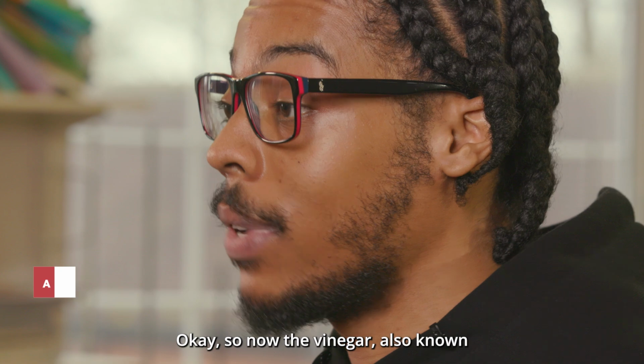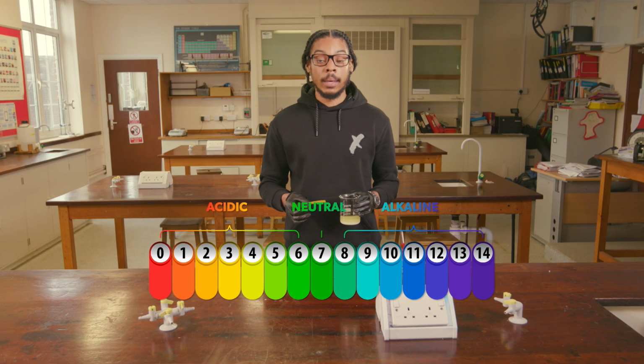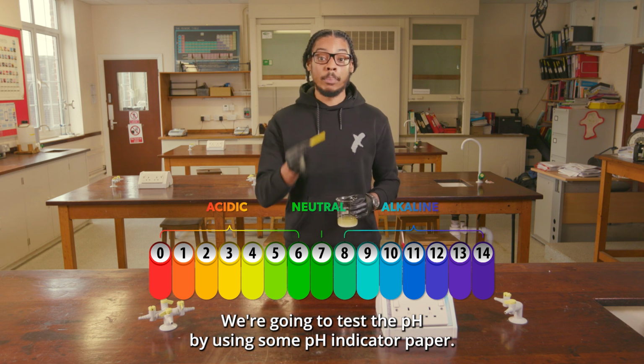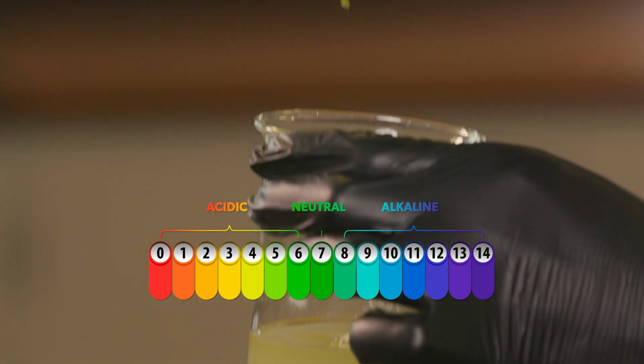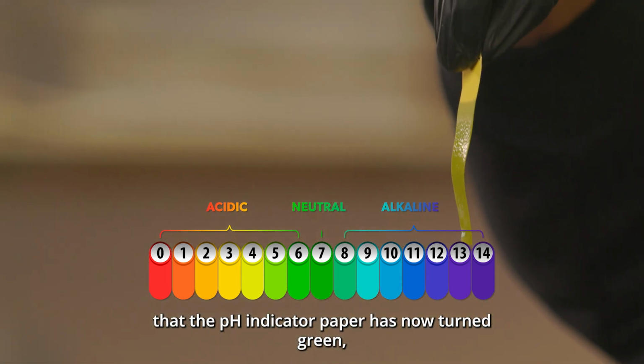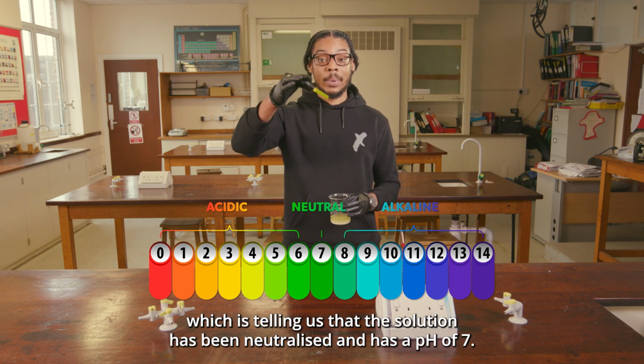Okay, so now the vinegar, also known as acetic acid, has been neutralised by the sodium bicarbonate, and we're going to test the pH by using some pH indicator paper. So we can see that the pH indicator paper has now turned green, which is telling us that the solution has been neutralised and has a pH of 7.